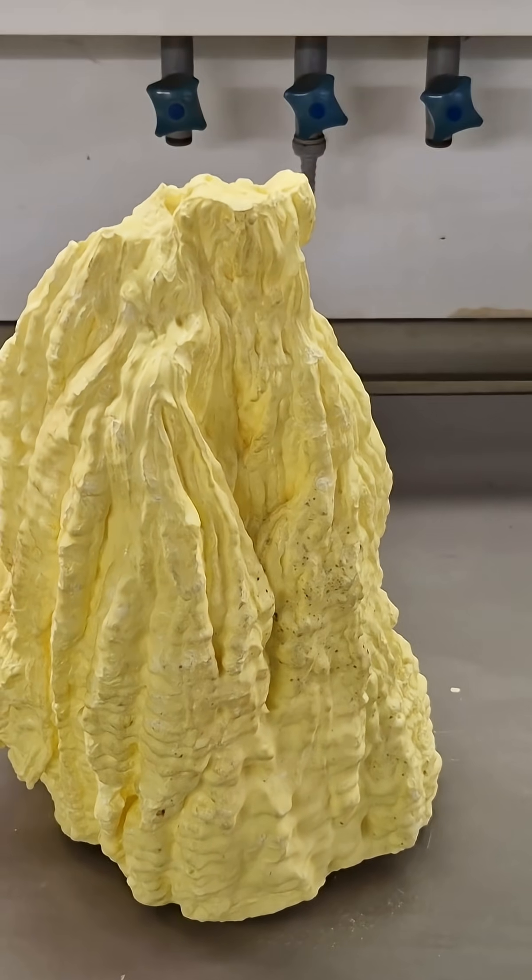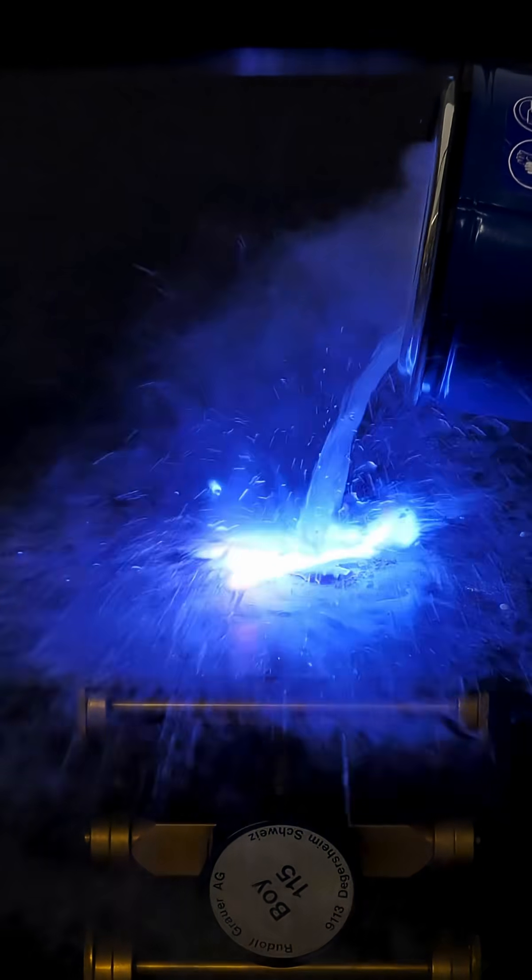Sulfur burns with an almost invisible blue flame and just melts away as it goes. Adding pure oxygen makes the fire fiercer and finally clearly visible.